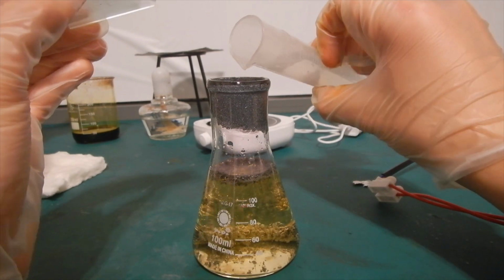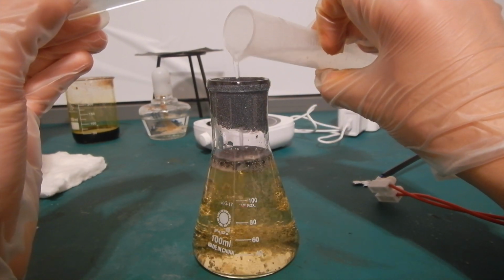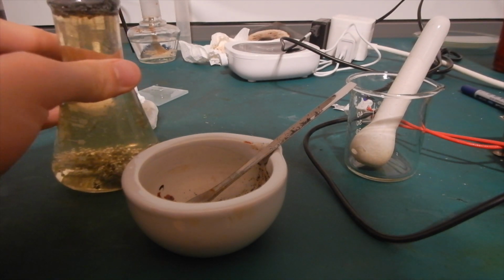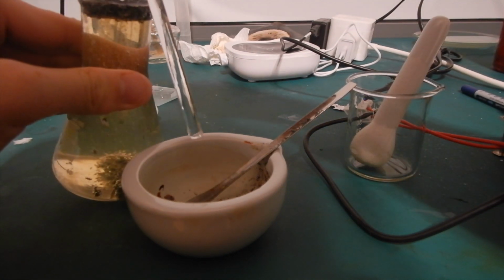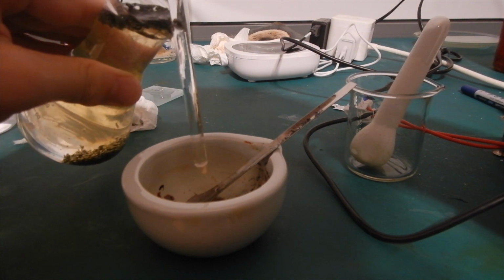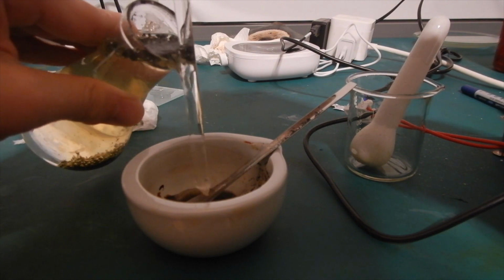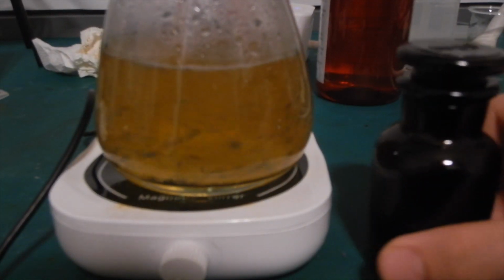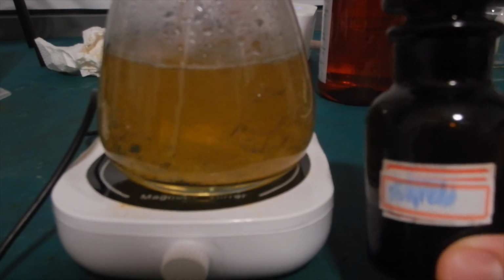More peroxide is added in, and I shook the flask to get down the iodine that stuck to the glass. I then carefully transferred a portion of the solution to the mortar I used earlier. This step will hopefully take up all the iodine stuck on the mortar and minimize the waste. I gave the solution a good stir and let it settle. After a few minutes, I transferred everything to a larger conical flask.